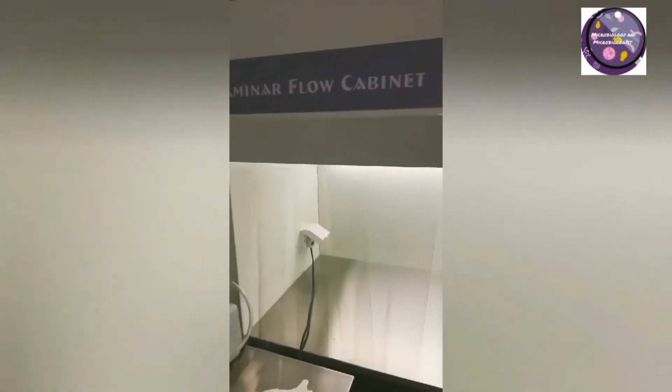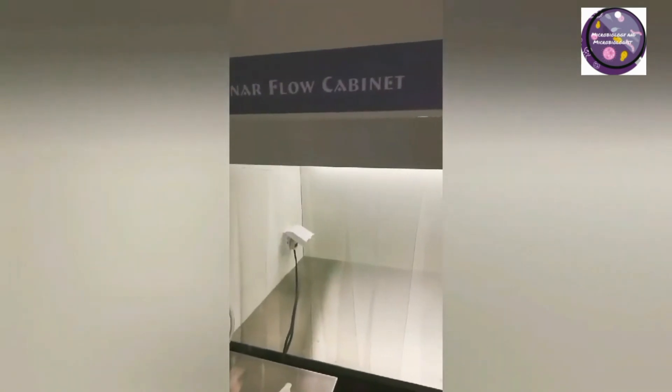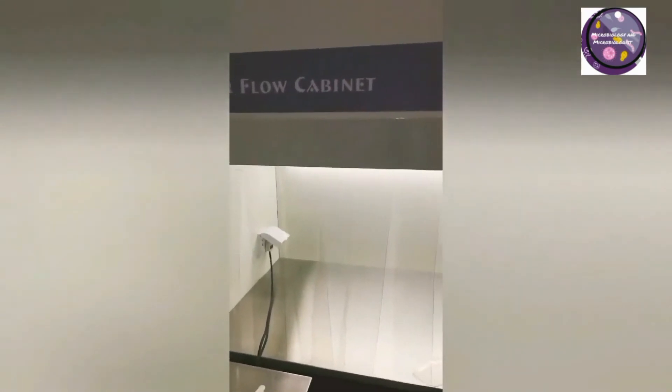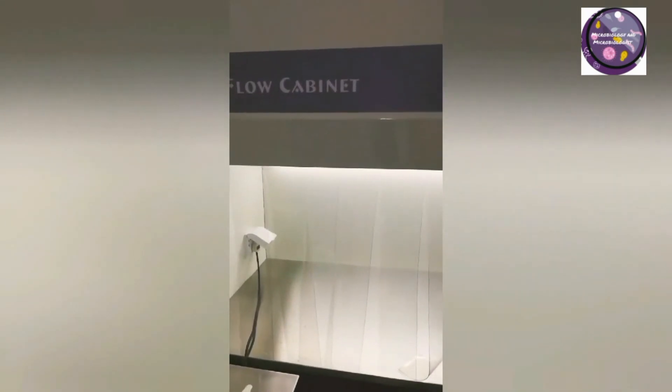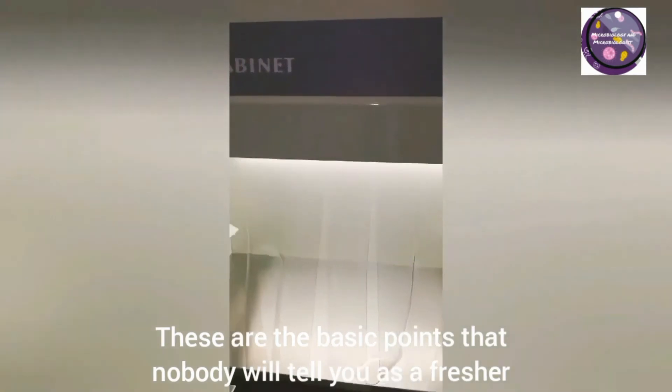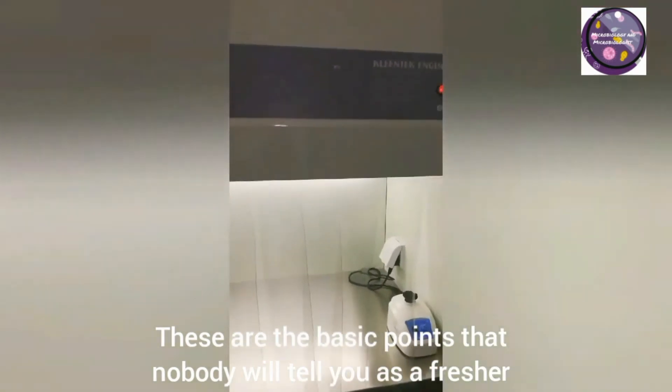These are some basic details of laminar airflow for freshers and fresh microbiologists. These are the basic things that nobody will tell you, but they are needed.